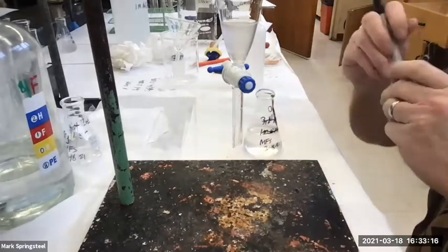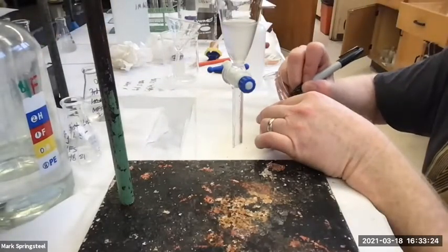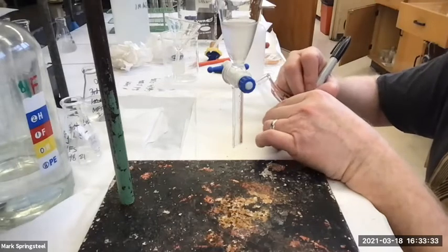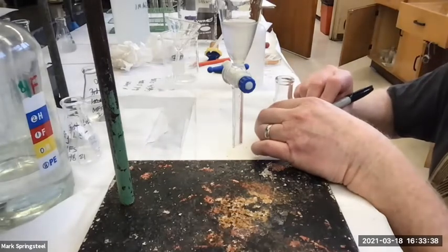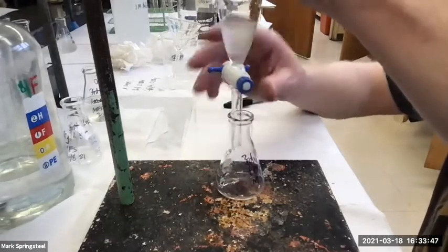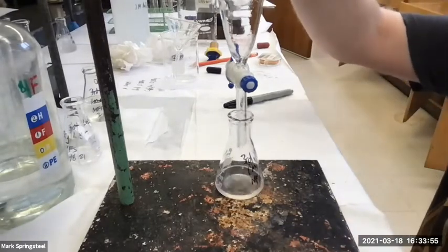Because the lower methylene chloride there. Whew, good thing I caught that, right? Easy to get mixed up on these. So this is going to be my third aqueous layer, and it's 1 molar sodium hydroxide, MFS 31821. Okay. Drain that in. I'll rinse it out with a little DI water.